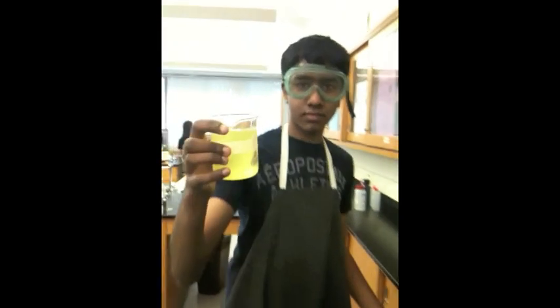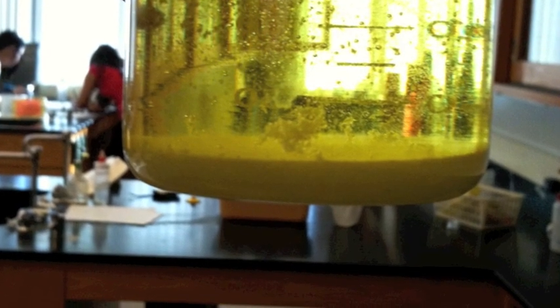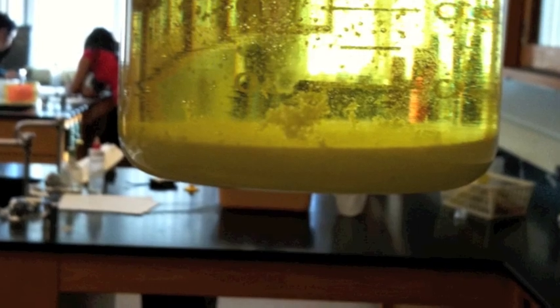When dissolved in water, strontium hydroxide dissociates into strontium ion and hydroxide ion. The strontium ion creates an imbalance. To reestablish this equilibrium, the excess strontium ion consumes some chromate to create the precipitate strontium chromate.